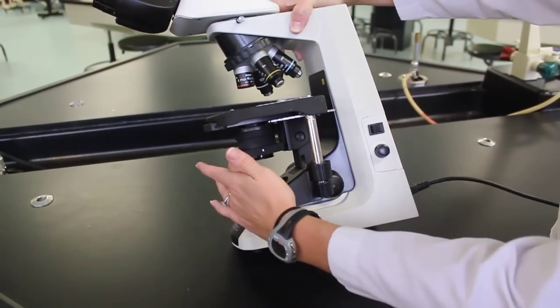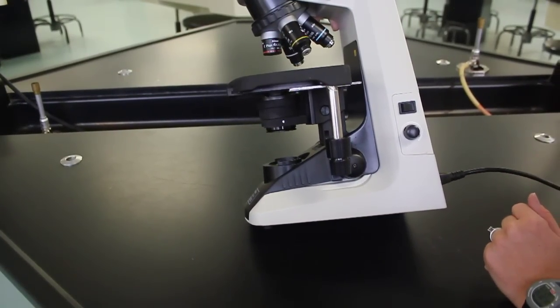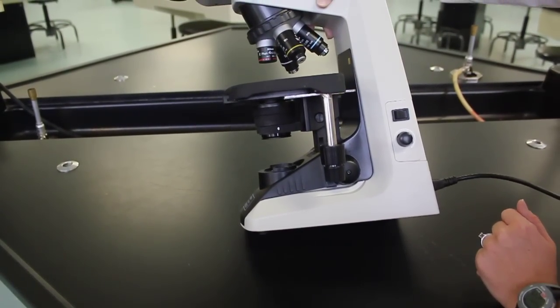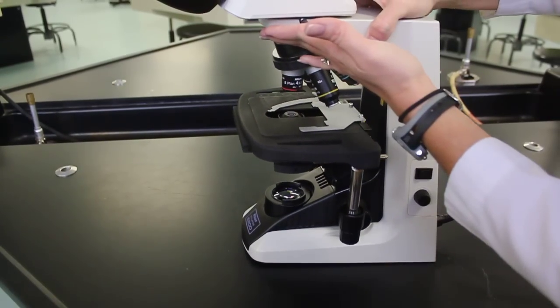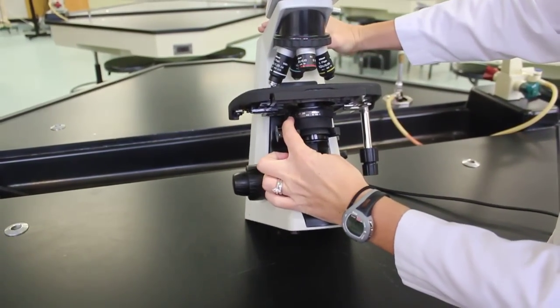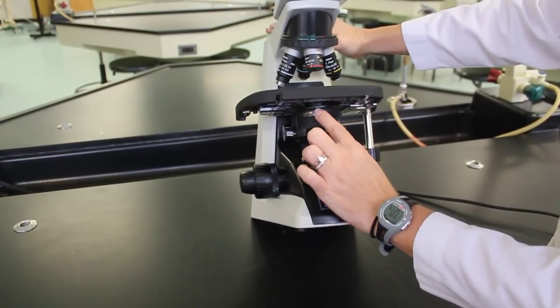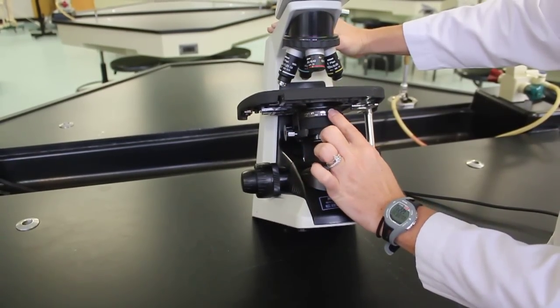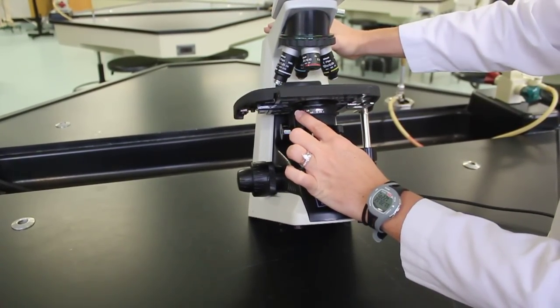Underneath the stage, this is the condenser. It controls the amount of light that comes in and narrows the light beam. A special part of the condenser is a switch located here. This switch is called the diaphragm. It is actually what opens and closes to control specifically the amount of light that comes in.